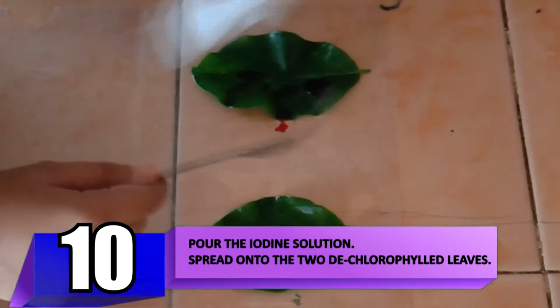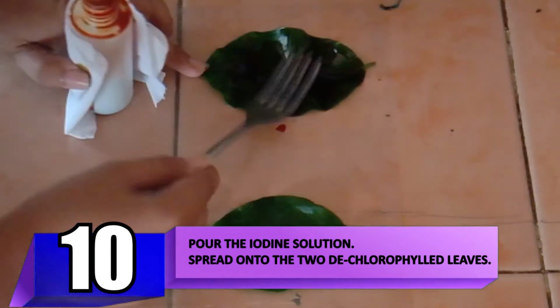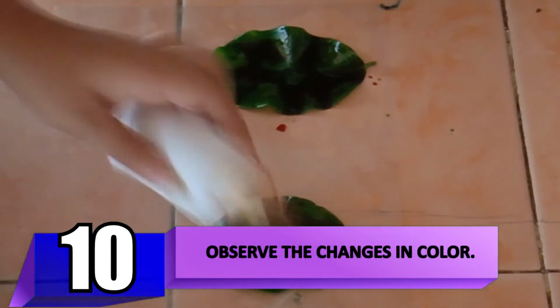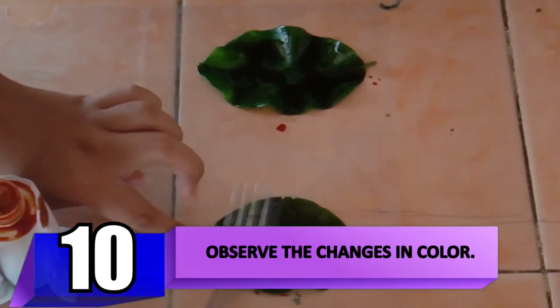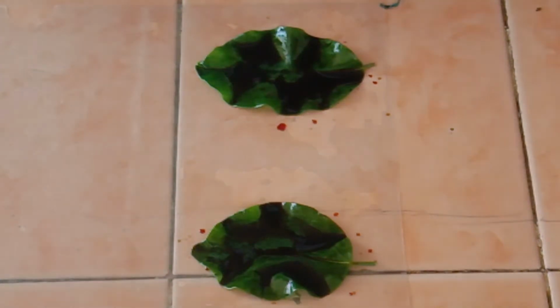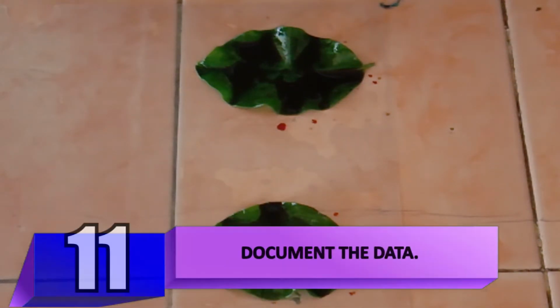Using the povidone iodine, pour and spread a portion onto the two dechlorophylled leaves. Focus on the color changing. The non-insulated normal leaf must appear blue to black, reflecting that it contains starch, while the insulated normal leaf must be brownish in color, indicating that it contains no starch. Document the data.